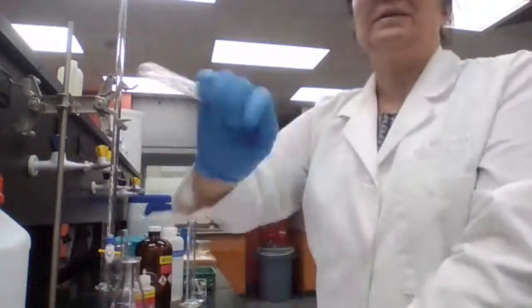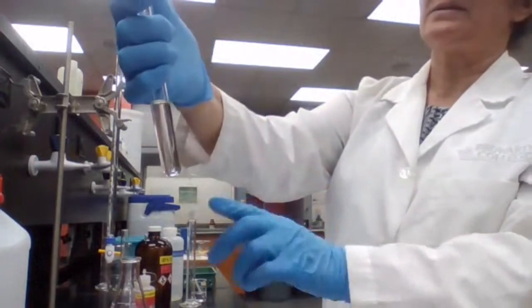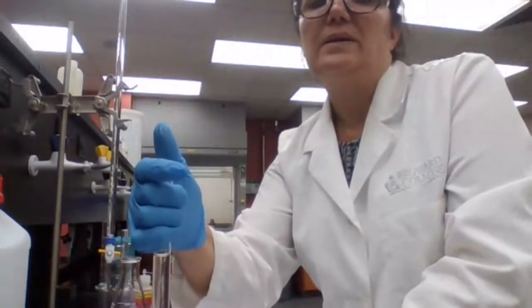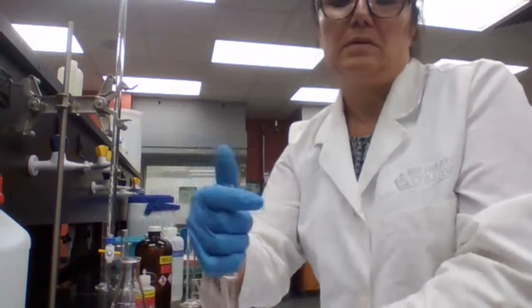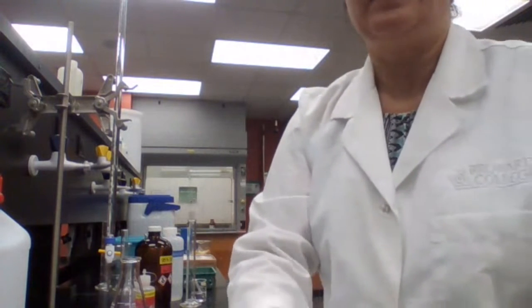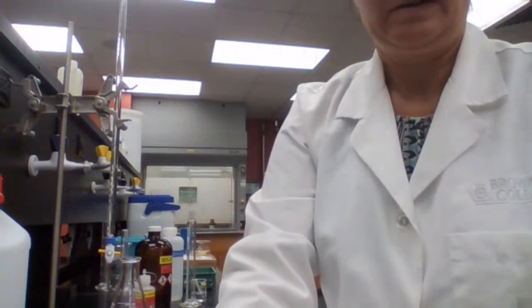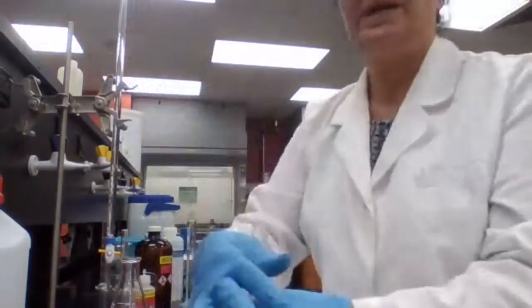Okay, the silver nitrate test, it doesn't work, and that's the case that we had in the past. And I said, if it doesn't work, it doesn't mean that it's not carboxylic acid. If it's positive, it's definitely yes, but if not, we cannot say it's not. So the same as the known sample, it behaved the same way.